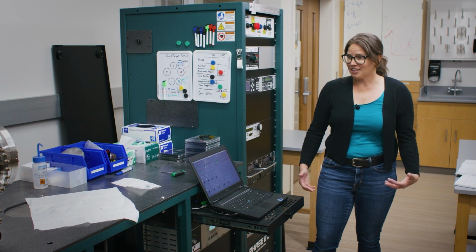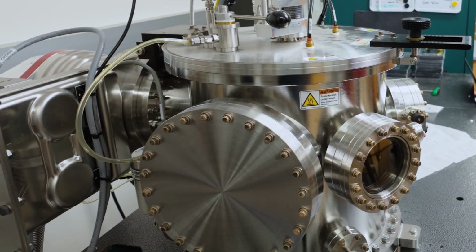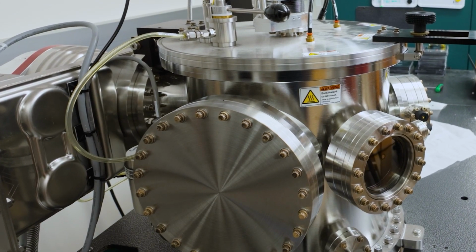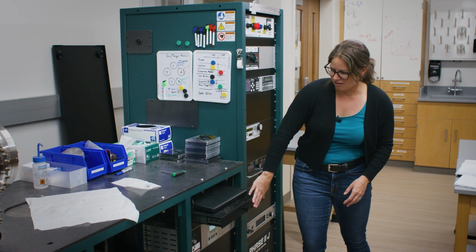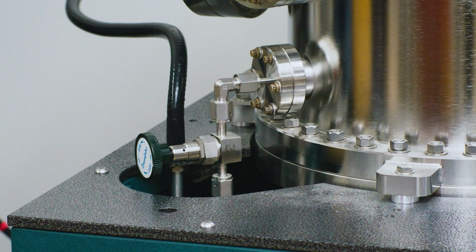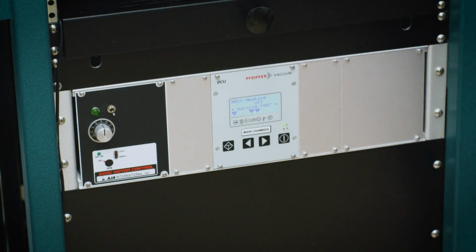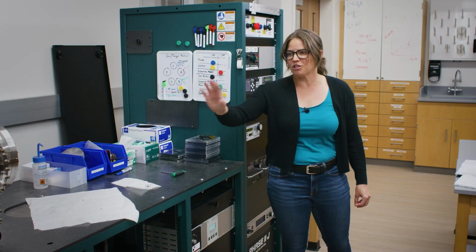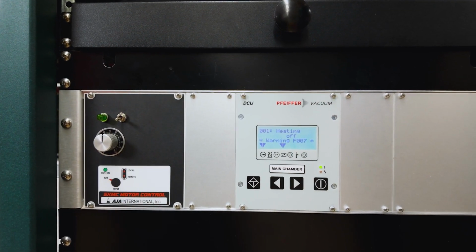All right, so you can hear kind of the pumps starting to wind down. That's the sound of the fans in our turbo pump slowing themselves down. So then one of the biggest things that we have to be cognizant of is when we can actually open the valve to let in air from atmosphere to our chamber. This is our turbo pump controller. You'll notice right now the screen is on. We do not open the valve on the chamber until this screen goes dark.